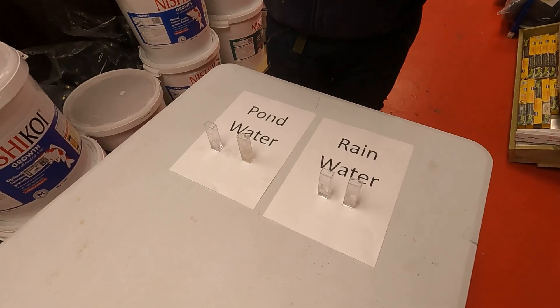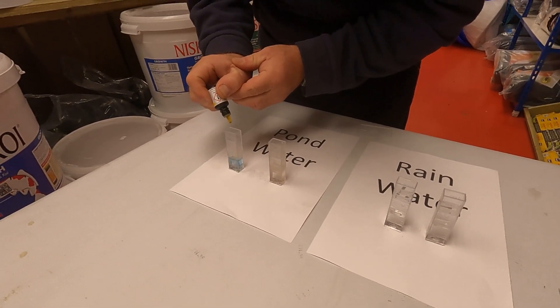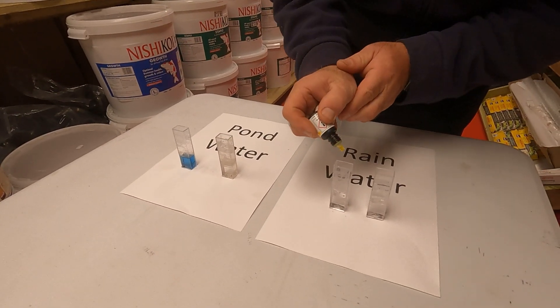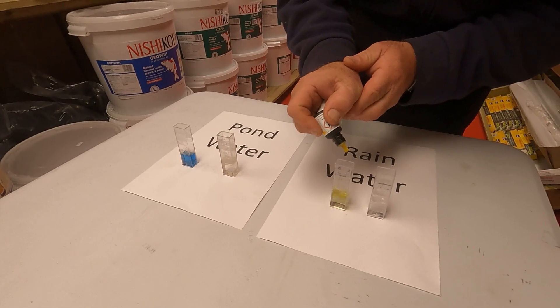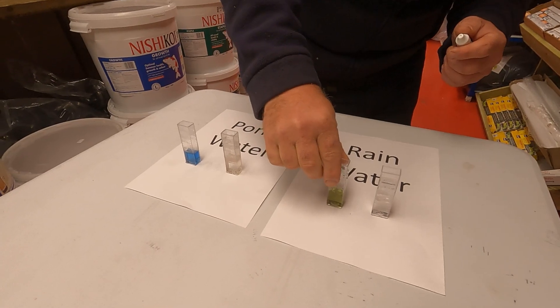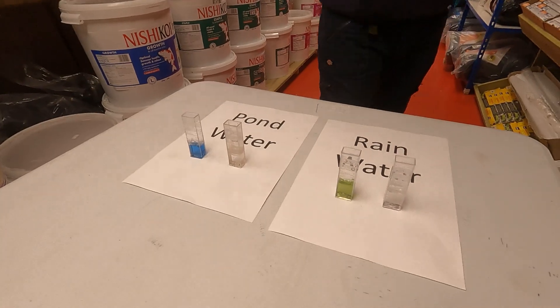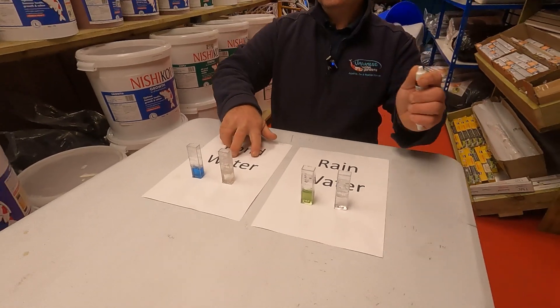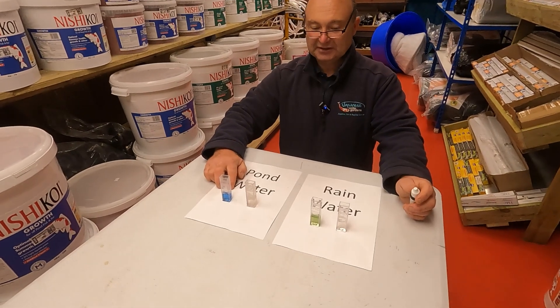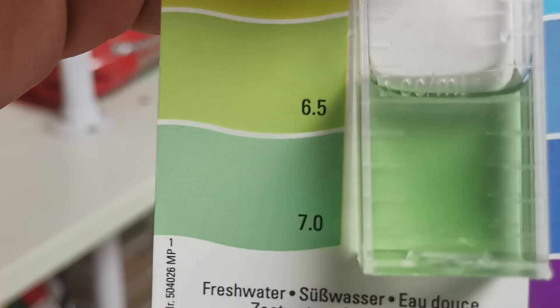We're doing a Tetra test kit and we use seven drops into five mil. We'll do the rainwater first — quick shake. There's a definite difference on that. Here's the pond water which is pH about eight — perfectly normal, that's exactly what we'd expect. Here's the rainwater. The pH on this is more neutral, so this would be pH around about seven.